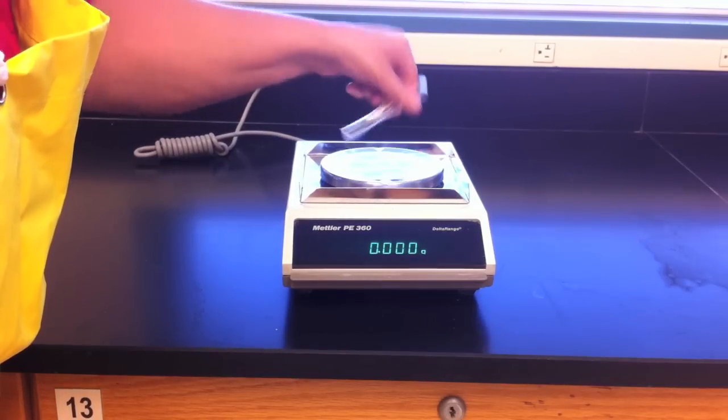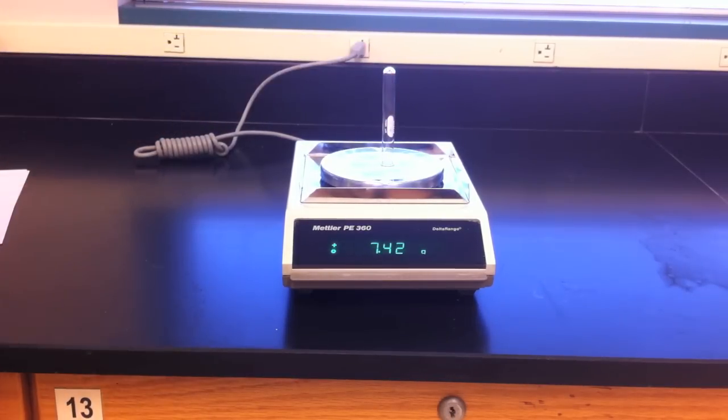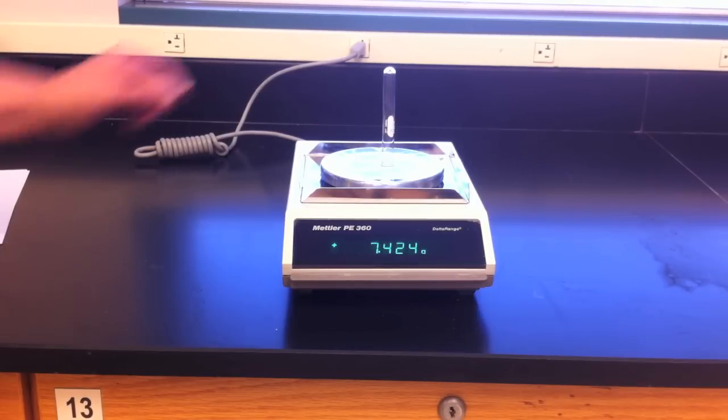You can place anything on the balance to measure it. Make sure that it's properly centered on the balance pan and does not slide off the pan.